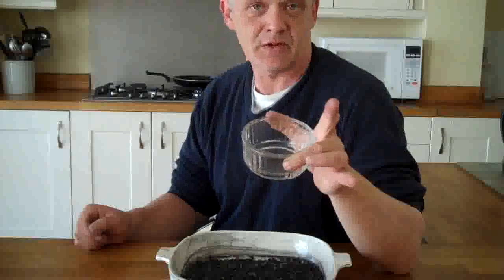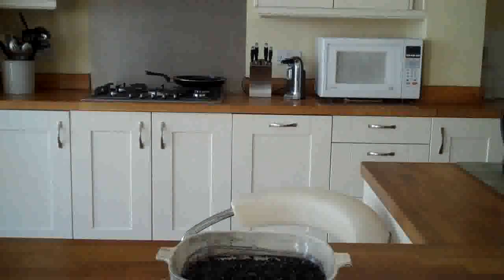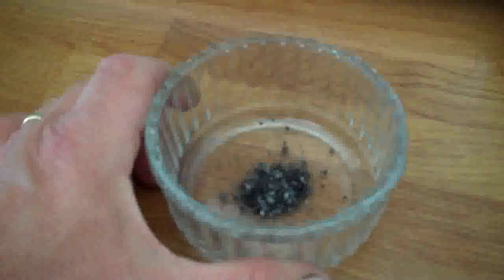Now what I'm going to do is microwave it for 20 seconds on full power. So we'll do that. So there's my minuscule amount of graphite, my quarter of a teaspoon in my ramekin. And this is going to get 20 seconds at full power. Now it does get very hot and it does arc. You don't need to worry about the arcing, you don't need to worry about the heat. Pop it in the microwave and press the start button. Now as that gets going, you'll begin to see it arc. There you go. Now it's getting pretty hot in there. Oop, that's something that cracked.